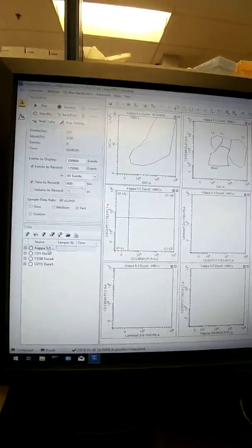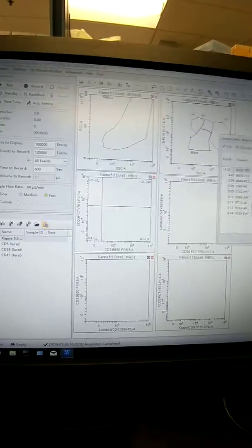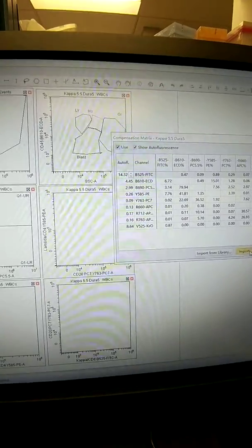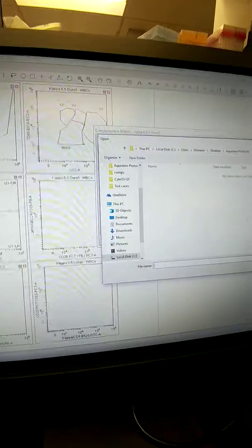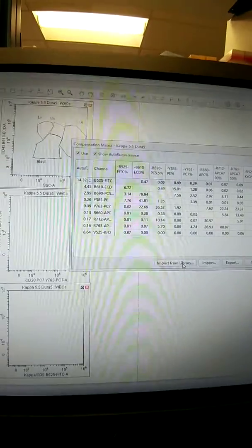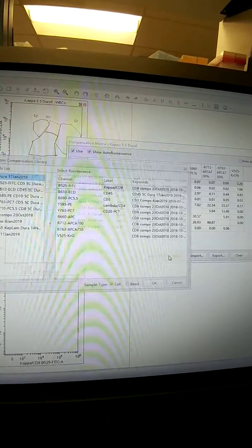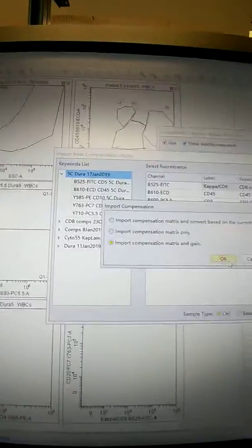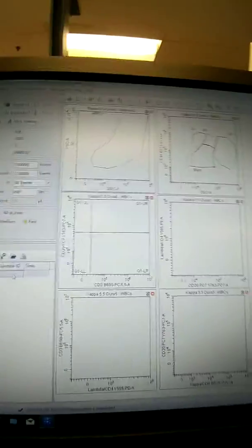Click OK. Okay, so now down here, let's see, the comps should be good. Oops, I don't. Got import from library. Okay, I'm going to add, let's see, nope. It's on those comps that I ran on the 17th, so that's good. I'm going to leave them there. Close that. But now I want to change the acquisition setting on this template.